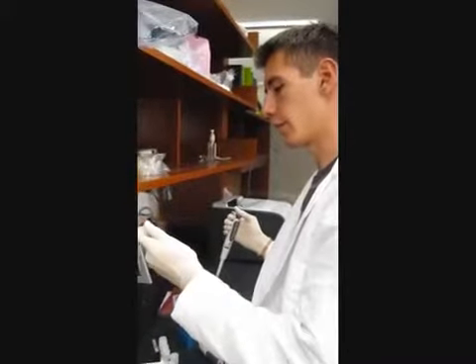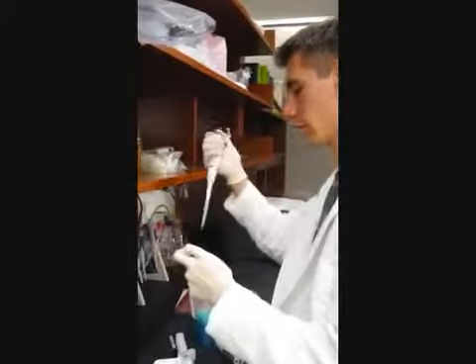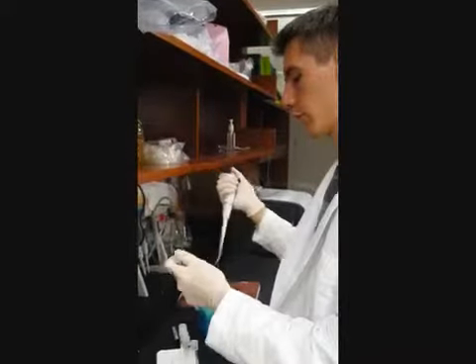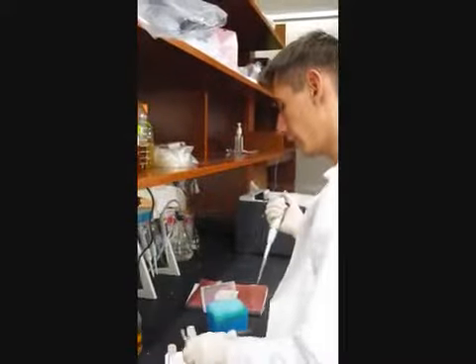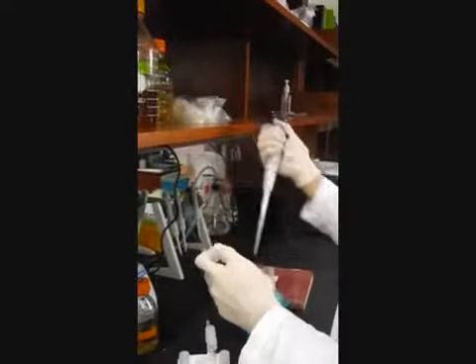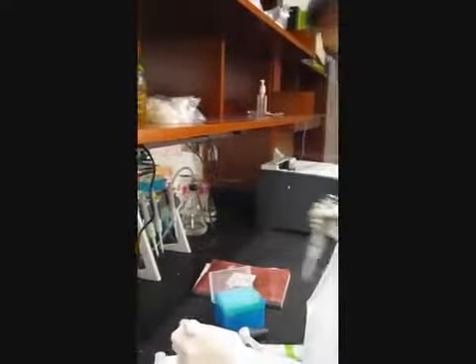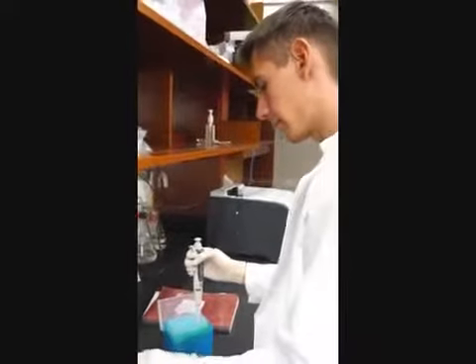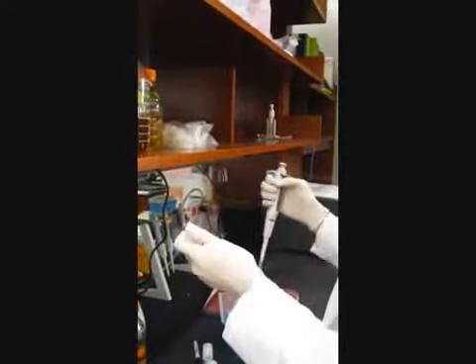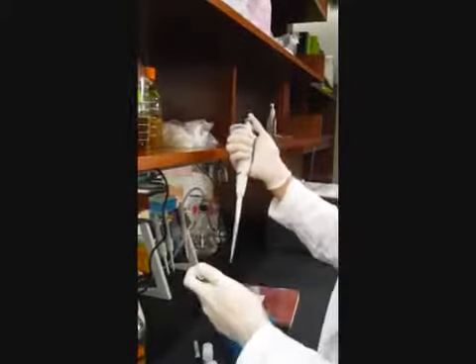So I just added 400 microliters of Listeria to the Coca-Cola. Now I'm going to do the rest with each one. Here's the H2O. This is a control. And that's done. Now these are going to culture overnight, like I said.